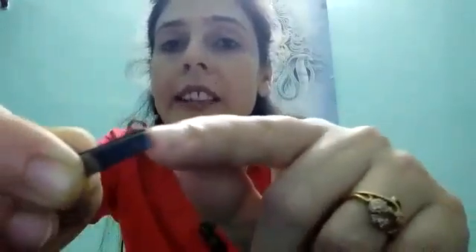Whenever insects sit on petals, the next part you can see is the male part of the flower, which is called the stamen. You can see a swollen part on the stamen — that is called the anther. The male gametes, which are pollen grains, are enclosed in these anthers. The anther is attached to the flower by a stalk-like structure called the filament.